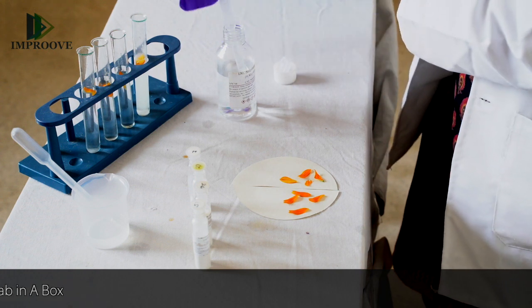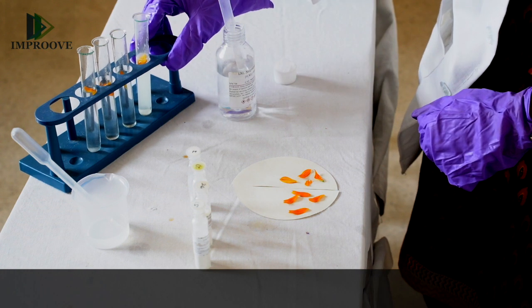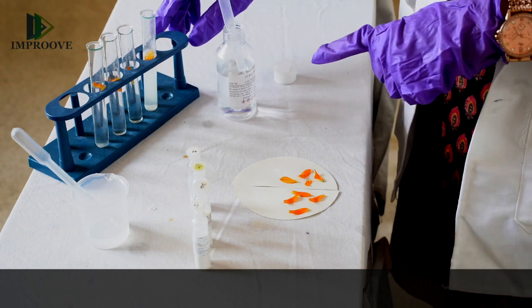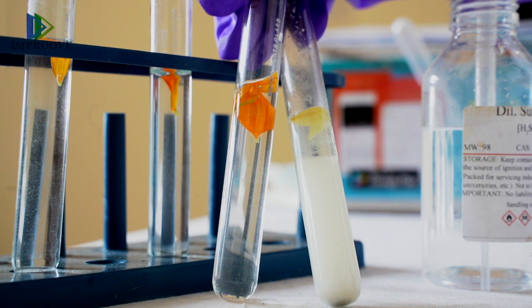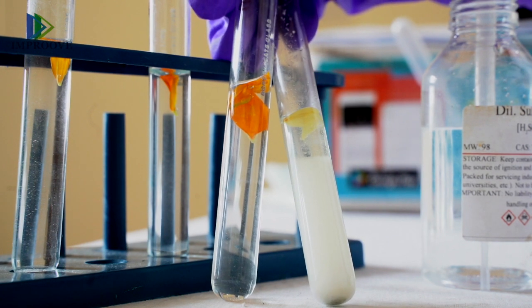Carefully observe each of the contents and the petals in the test tubes. After five minutes when you look at the test tubes, you will notice that in test tube A the flower petals were bleached. This identifies for us that in test tube A the salt sample which was present was bleaching powder.